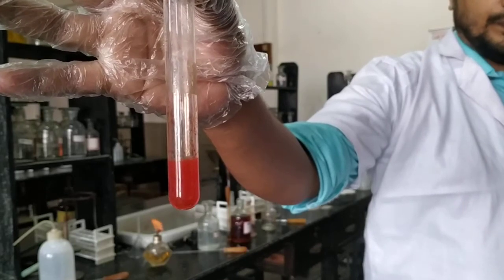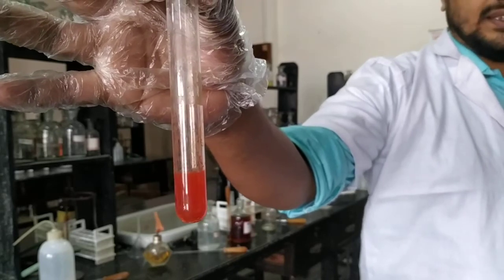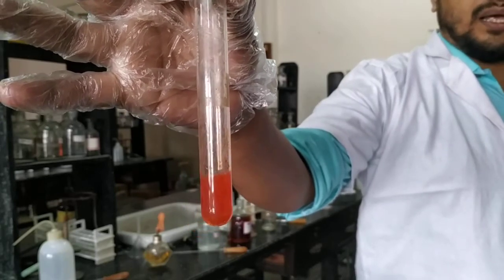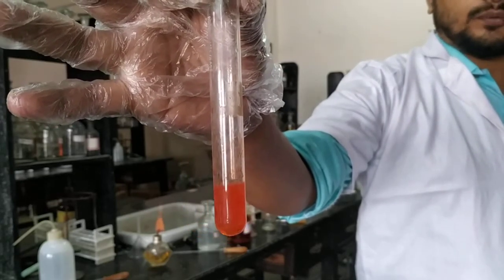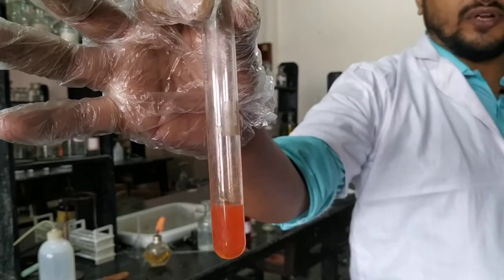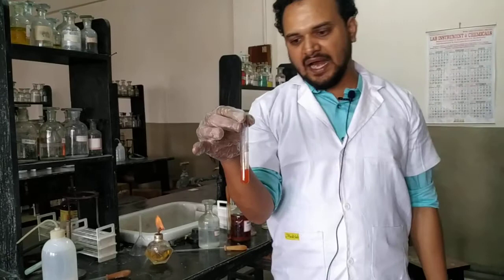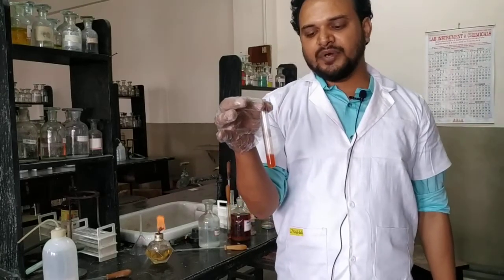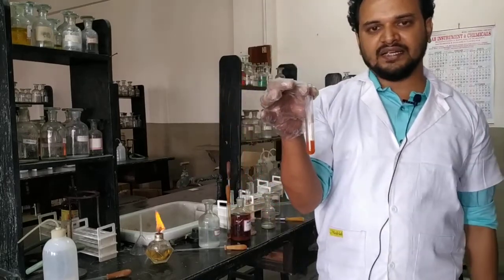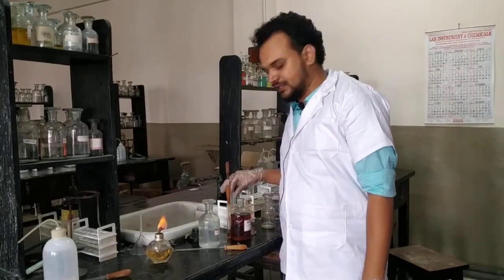See, it is becoming yellow. This is the first test for acetone — the nitroprusside test. In the experiment column you will write: 1 ml of acetone and 2 drops of dilute NaOH was added and shaken well, then 4 to 5 drops of freshly prepared sodium nitroprusside solution was added and immediately warmed. A brilliant ruby red color appeared which turns yellow on standing and cooling. That is our first test for acetone.